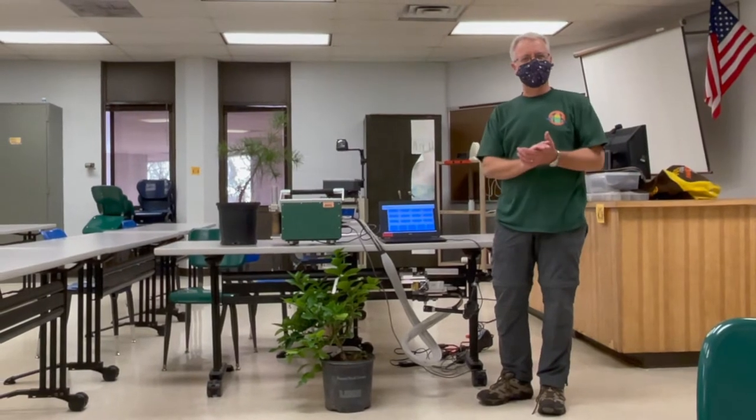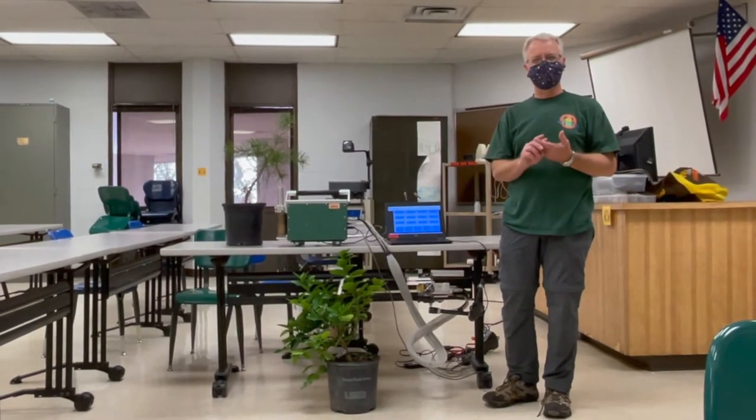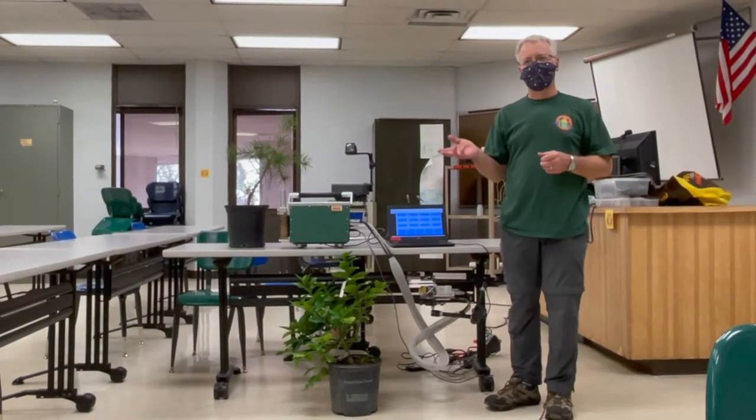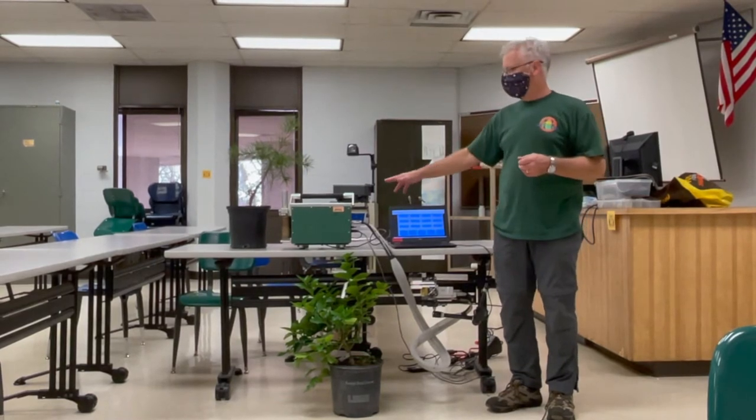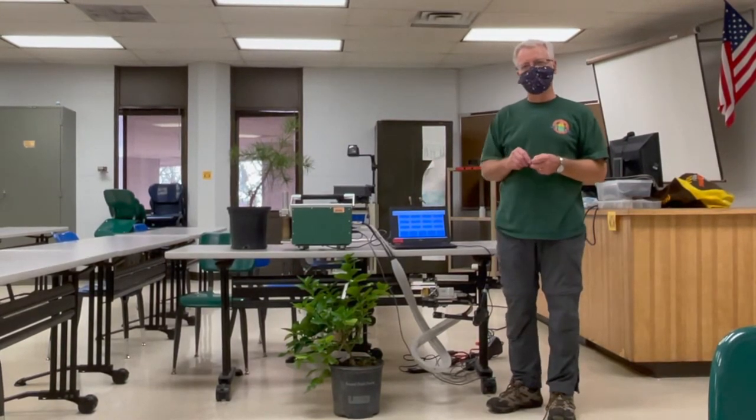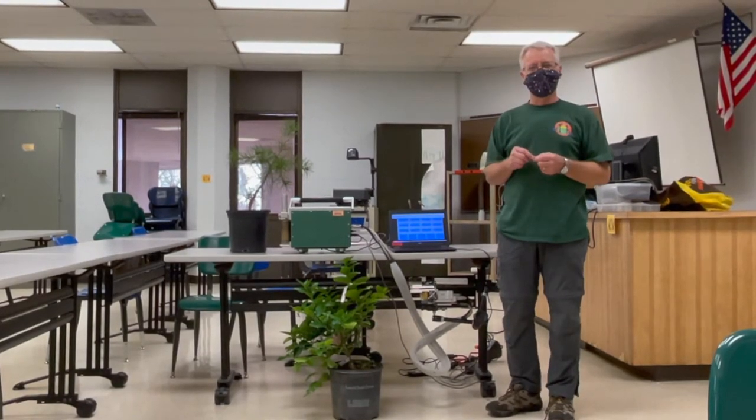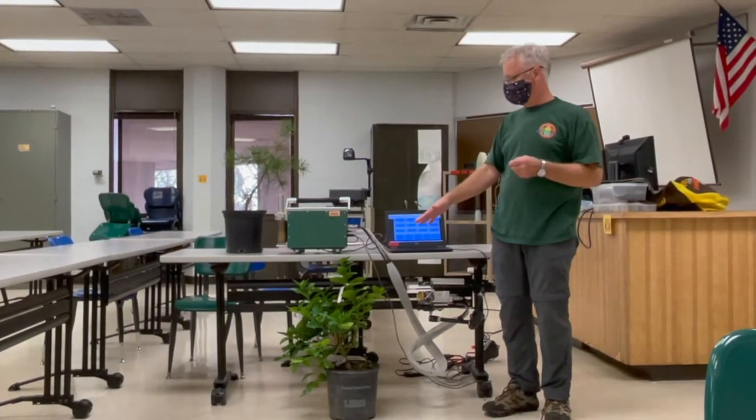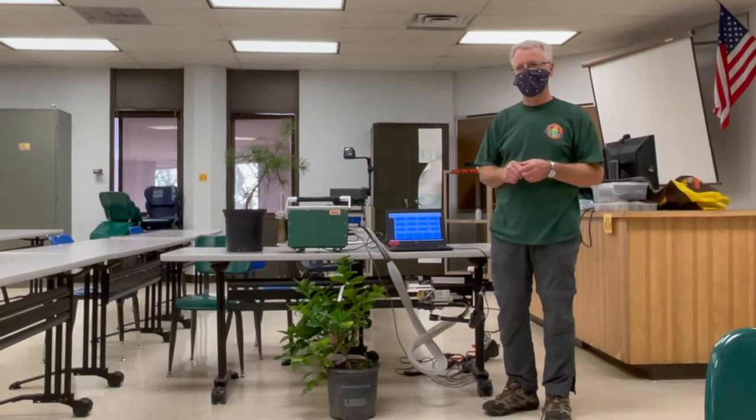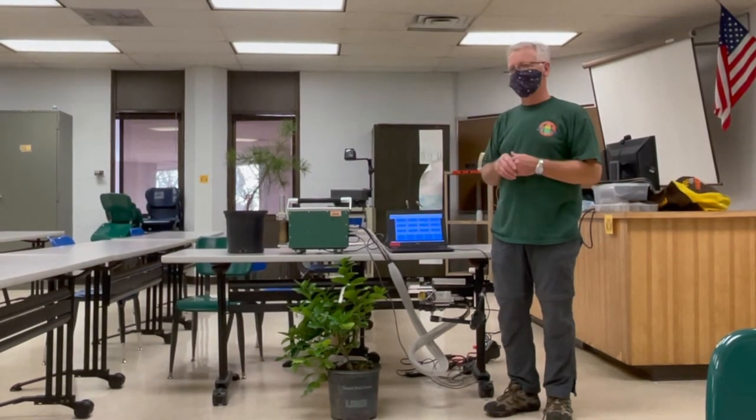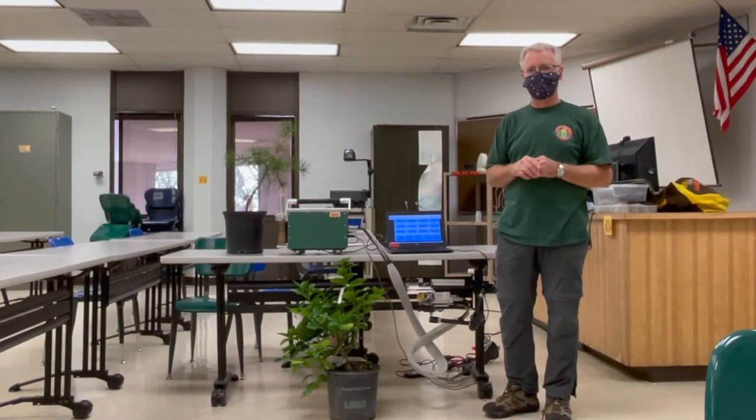For this lab we're going to have two main activities. In the first part, we're going to use the Licor 6400 photosynthesis system to measure net photosynthesis rate of leaves on an angiosperm, a potted citrus tree, and then on a gymnosperm, table mountain pine Pinus pungens.